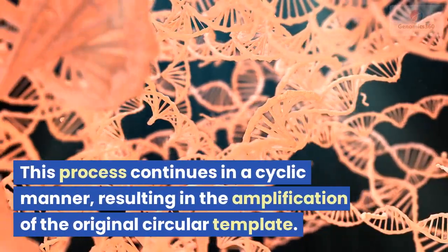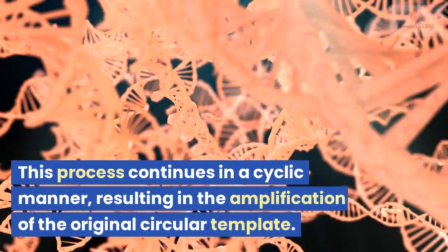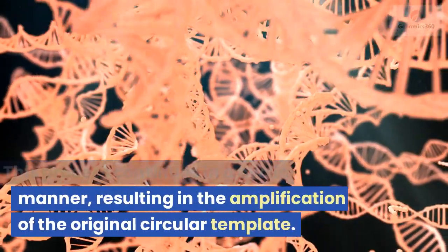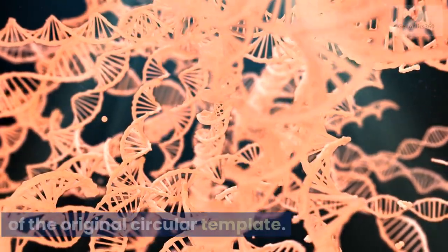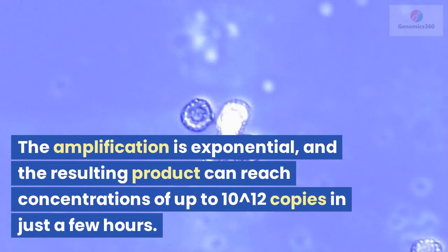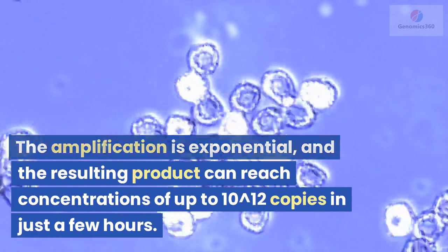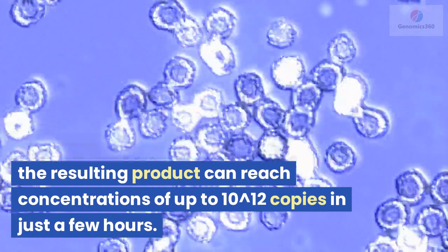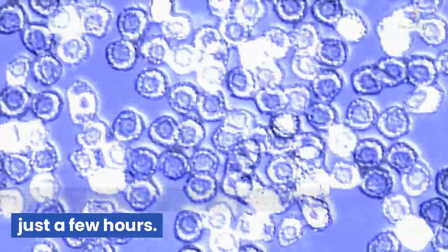This process continues in a cyclic manner, resulting in the amplification of the original circular template. The amplification is exponential, and the resulting product can reach concentrations of up to 10 to the power of 12 copies in just a few hours.